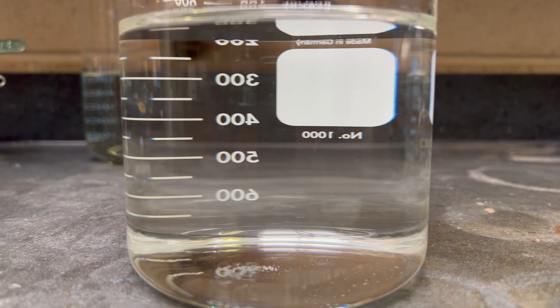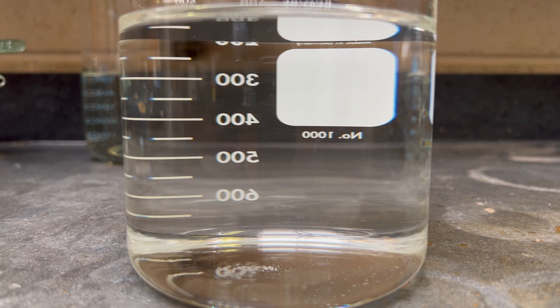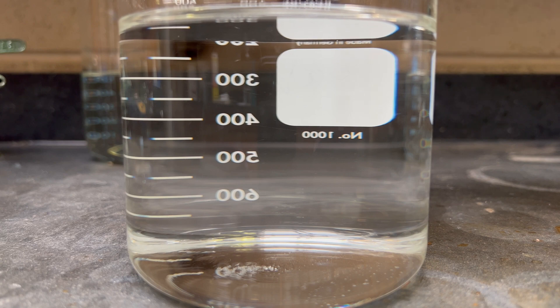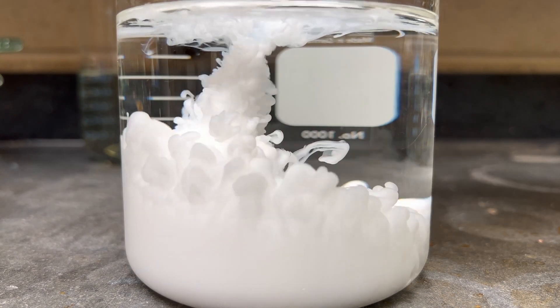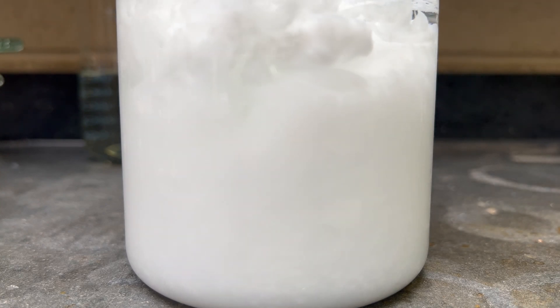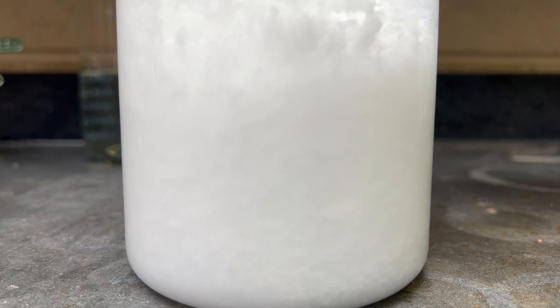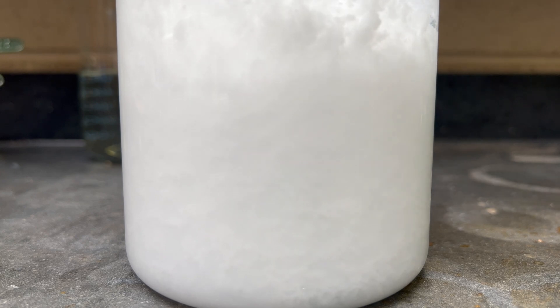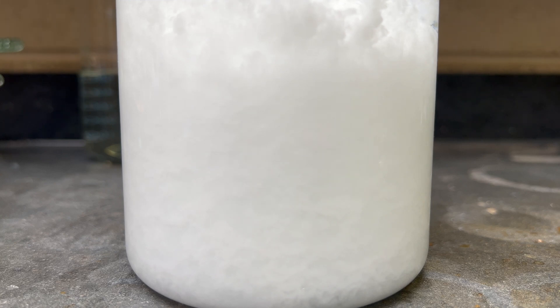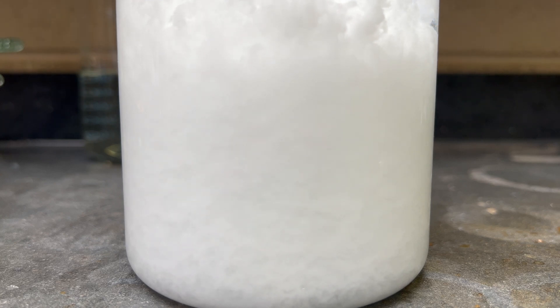Next, add hydrochloric acid. Hydrochloric acid reacts with the potassium benzoate to form the precipitate of benzoic acid. The precipitation is due to the lower solubility of benzoic acid — 3.44 grams per liter at 25 degrees Celsius — compared to potassium benzoate at 73.83 grams per 100 milliliters at 25 degrees Celsius. Adding HCl also reacts with the byproducts of potassium hydroxide to produce potassium chloride.